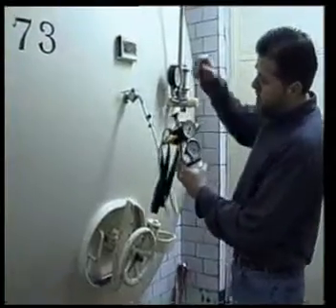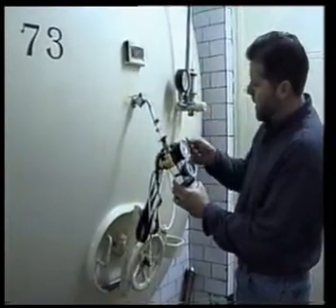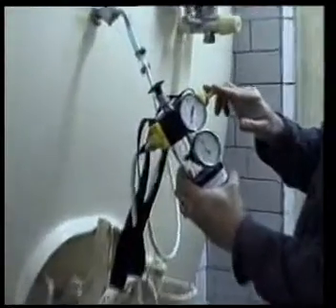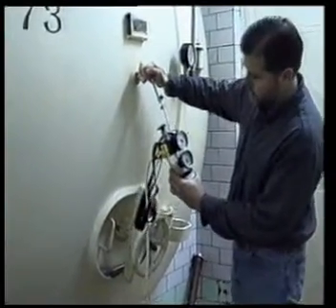Next, close the output valve and open the input valve — this is in the open position — and open the swivel to get the beer pouring in.